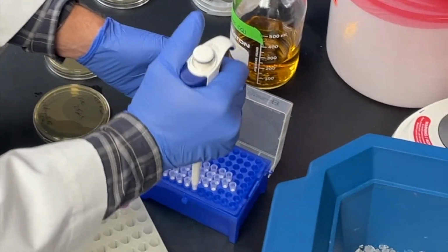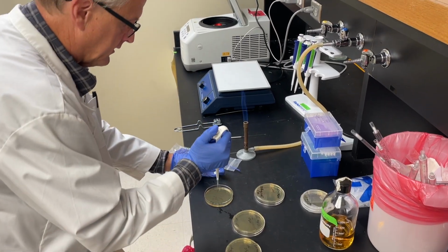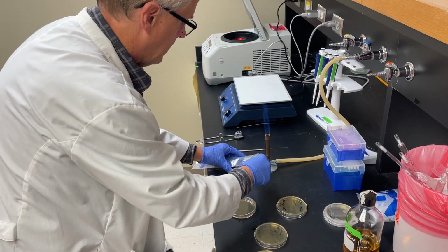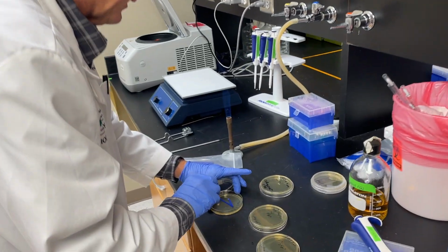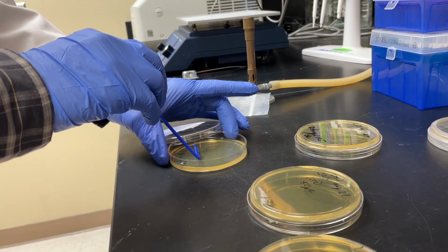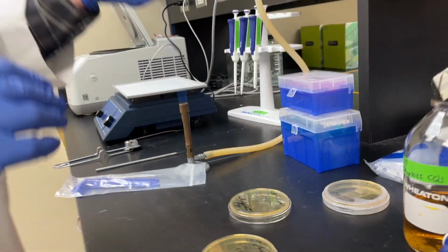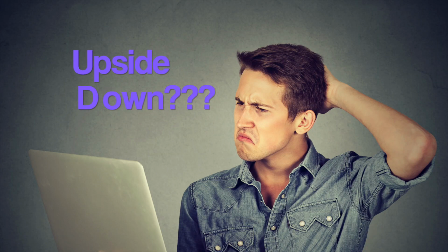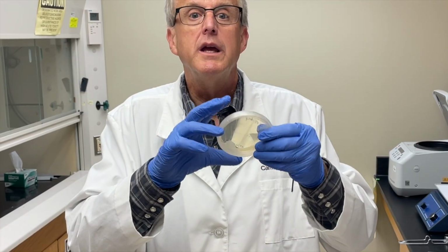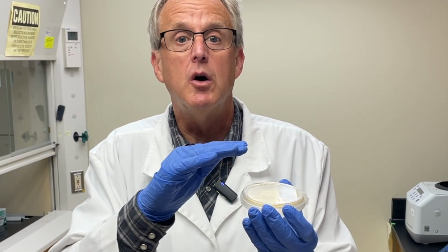You can add 100 of the undiluted. Just kind of put it in the center. Now I'll take our sterile spreader. Here we go. Just kind of move it around. Spread it out. Turn it back upside down. When we plate, we put everything on the bottom of the plate that has the agar. When we incubate it overnight, it helps prevent contamination, and what it will do is just grow.